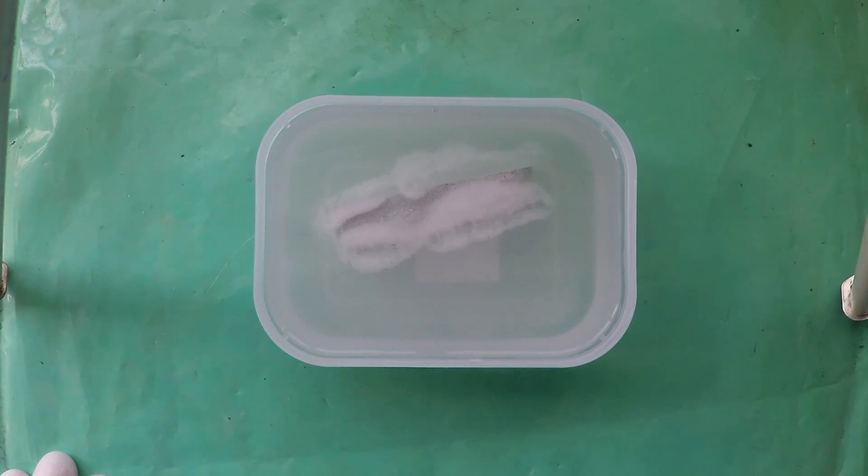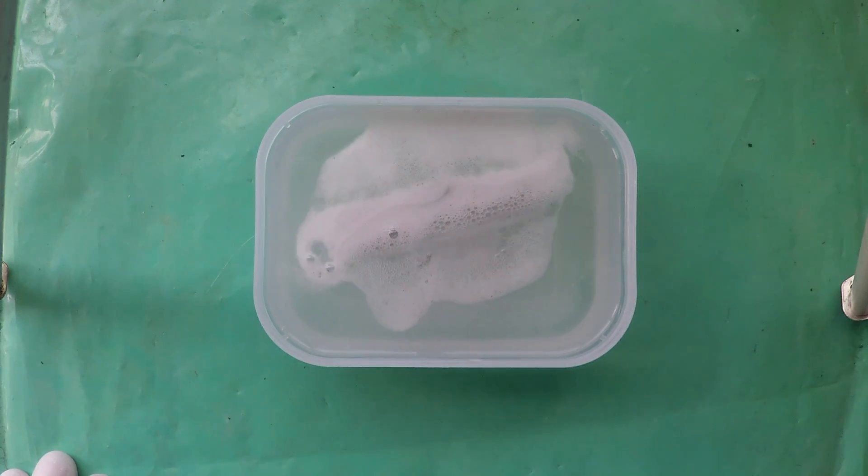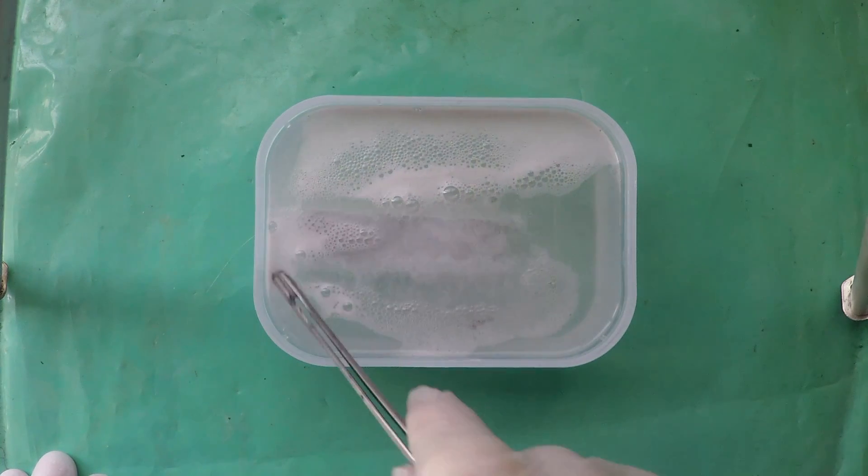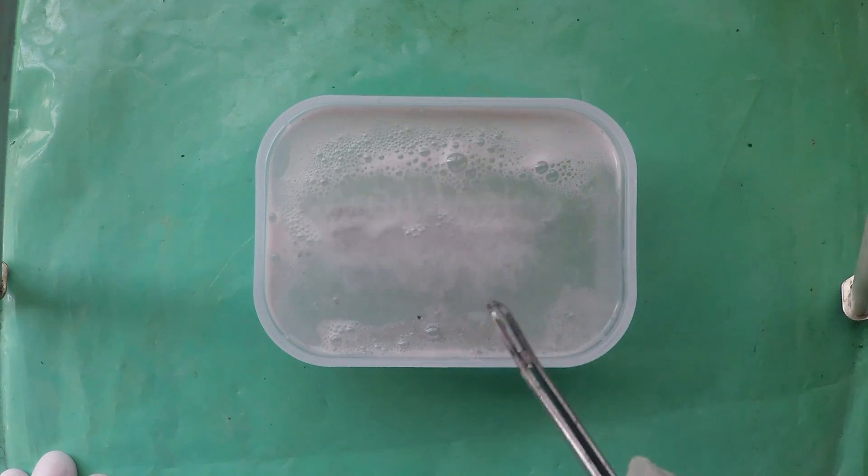So all right we'll drop this in carefully. I don't want to splash it. And this is what you should see happen. Lots of nice little bubbles of gas coming up. We'll give that you know 30 seconds a minute something like that.